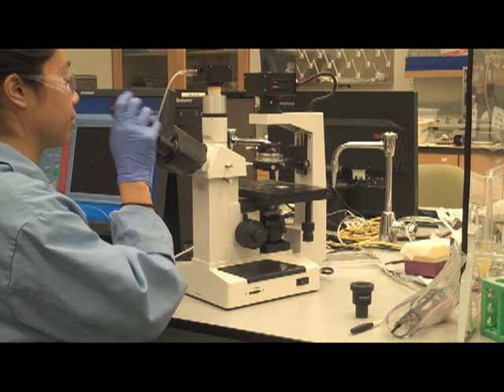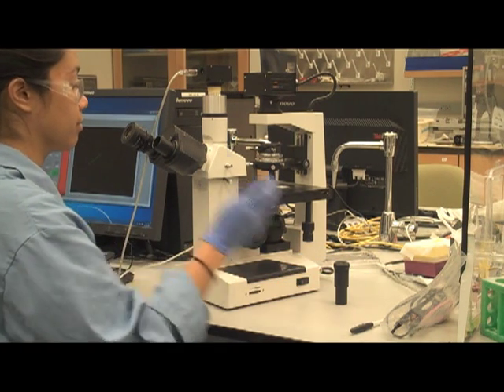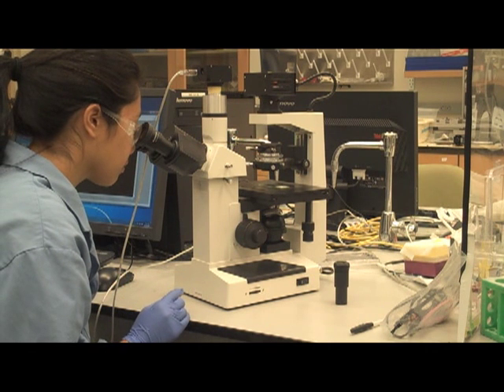Step 14: Take out the center telescope and insert the original eyepiece to observe the phase contrast.